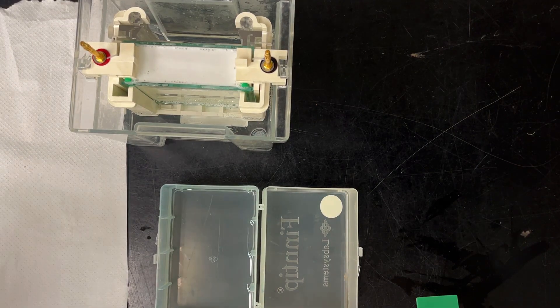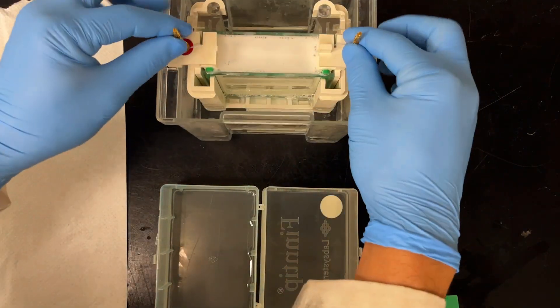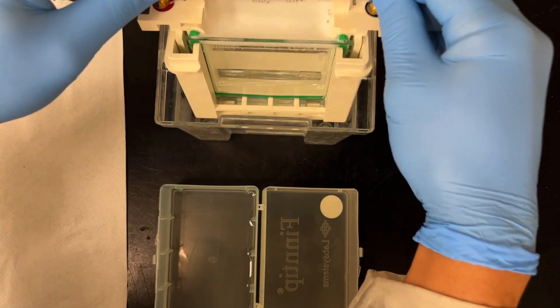Because staining a gel is relatively simple, I just wanted to redeem myself for that mess of a gel that I made last time.